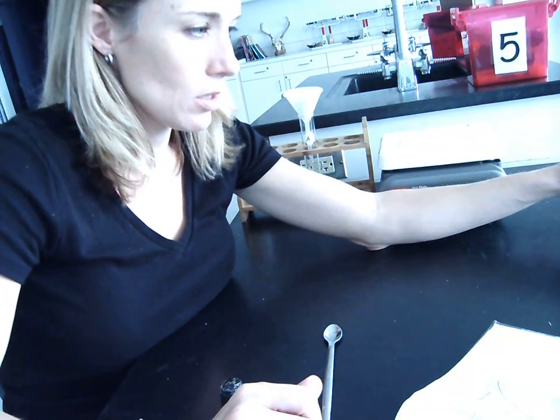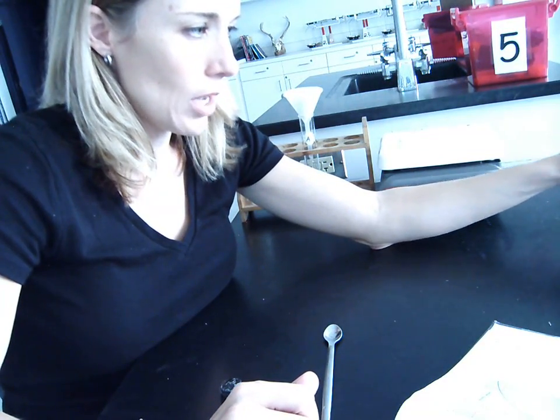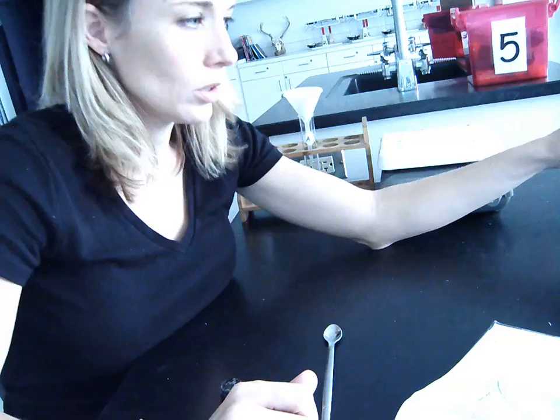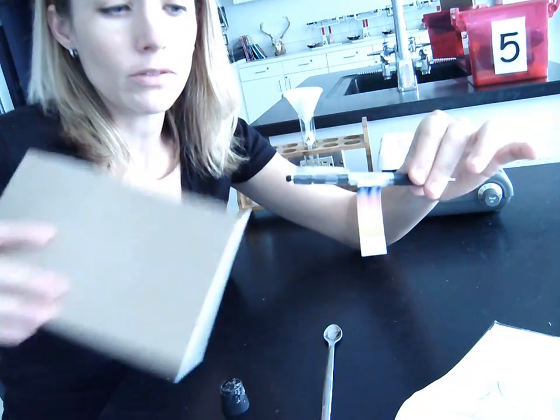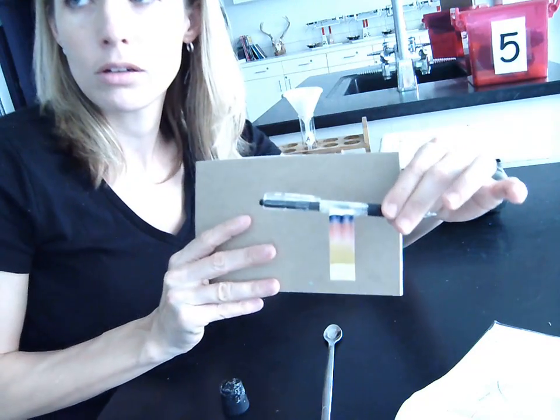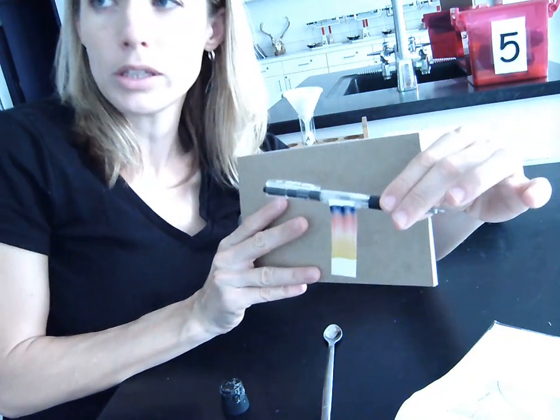5.6. Okay. This is really cool. And I hope you can see it. Yeah, you sure can. Okay. Let's see if that helps if I put that back there, away from the glare a little bit.